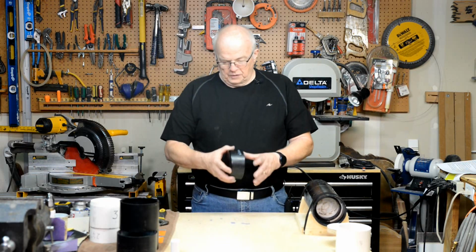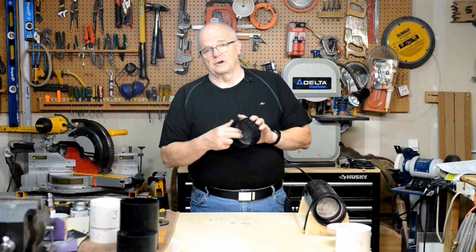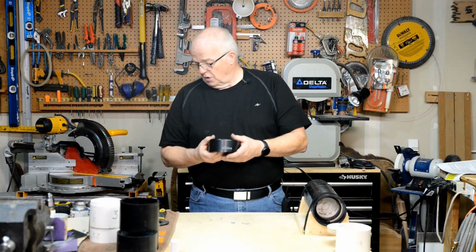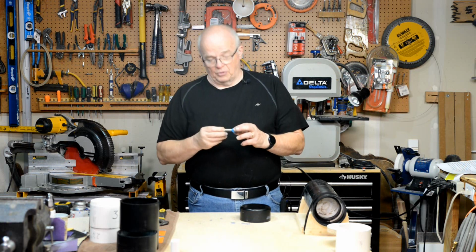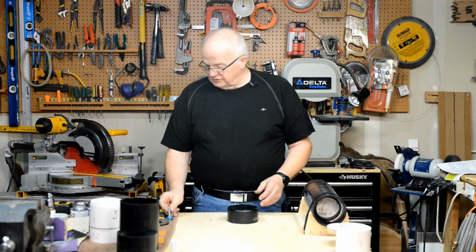Okay, it's been over an hour. It's been about an hour and a half since I glued this acrylic into the bottom of this cap, so we're good to go as far as drilling a hole in it. And this is where this 1 1/16 inch Forstner bit is so important, because it drills the holes that will allow that PVC pipe to fit inside of there.